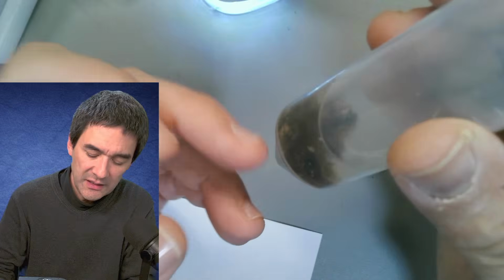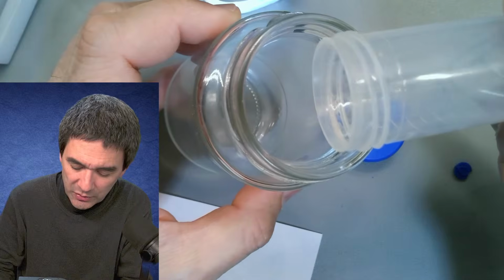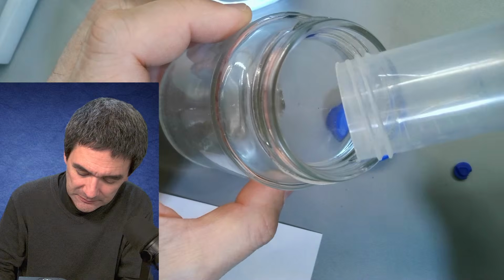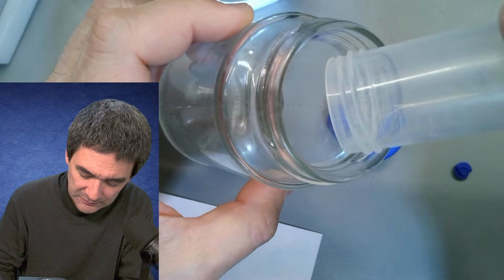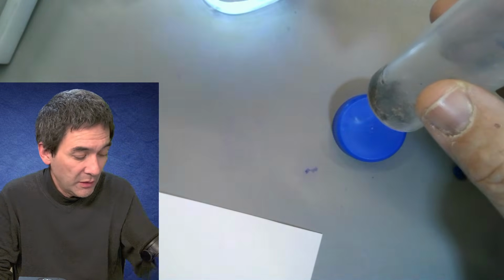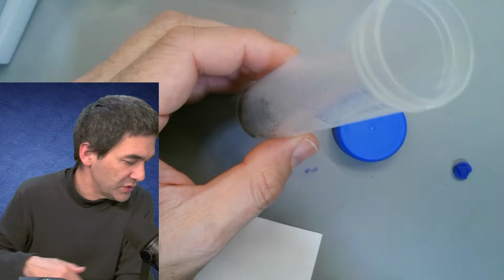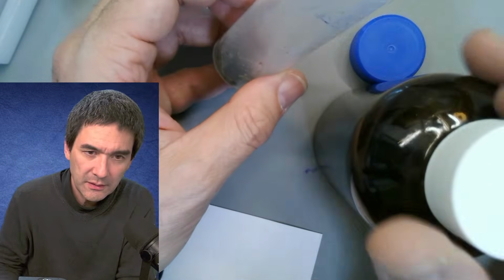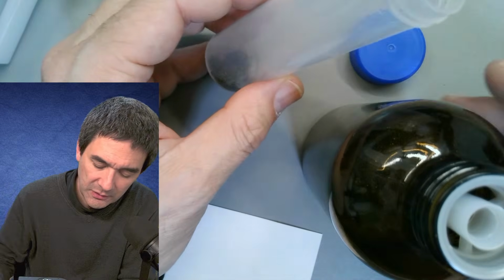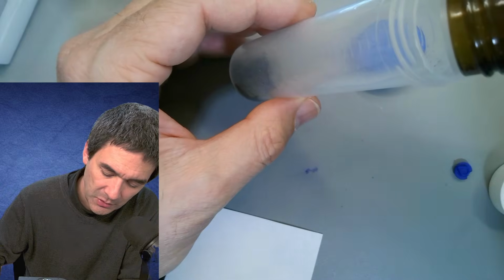So the first thing I'm going to do is, this is all pond water, so I have to first remove all of this excess water. So I'm going to just carefully dump as much as I can. Okay, and now this is where I have to be a little bit careful. I now need to add the hydrogen peroxide, and I'm going to use the concentrated one, and I hope it's still okay. And then it will start digesting everything away, and I will continue this next week because there is some time needed.